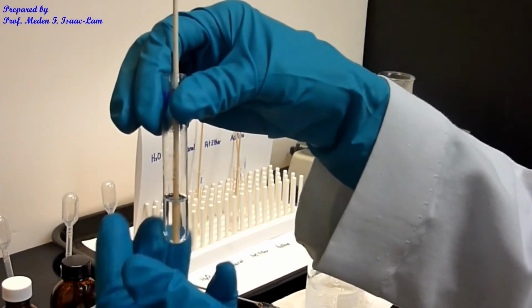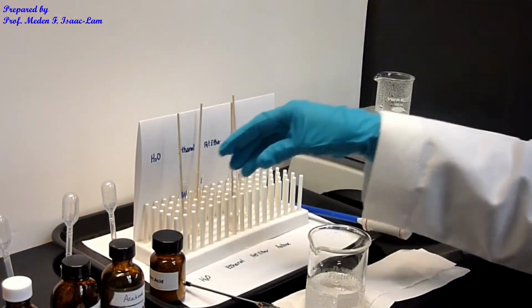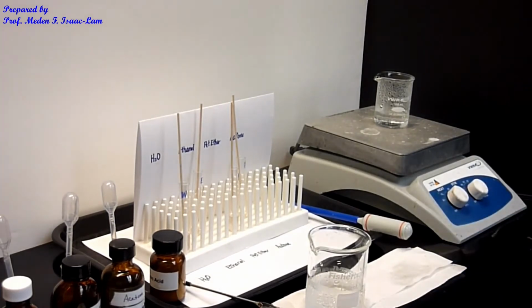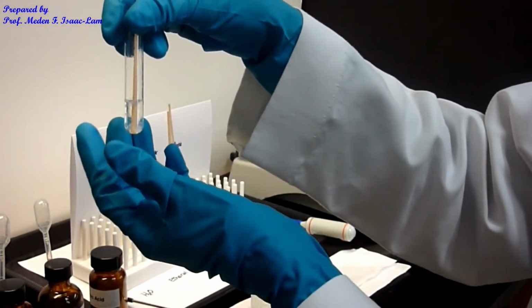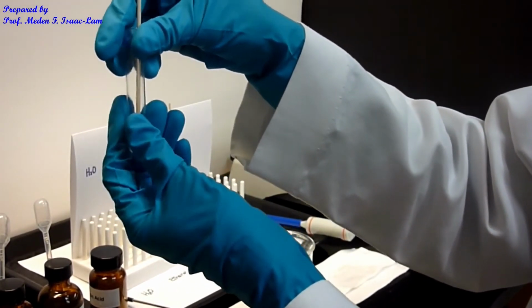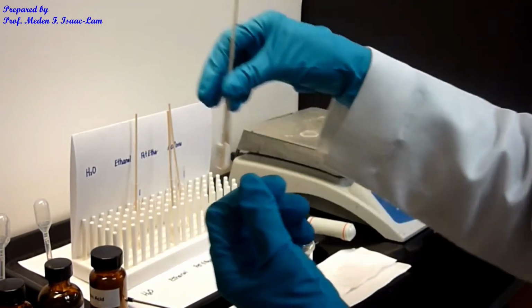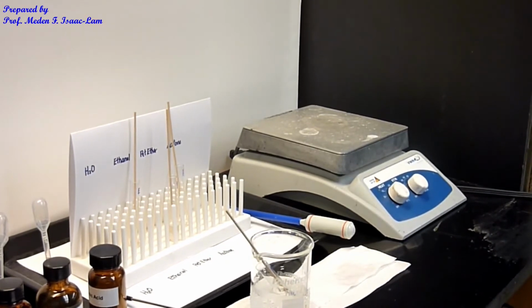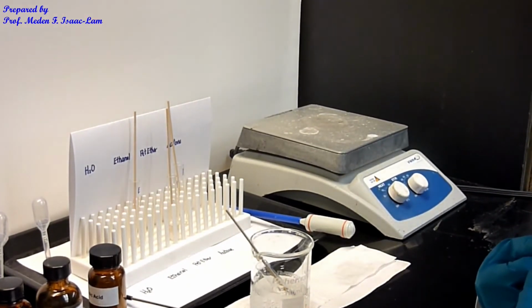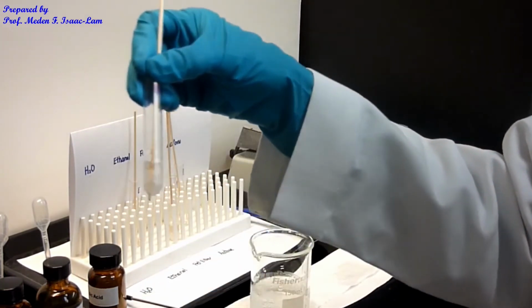Okay. So when it gets to room temperature, I'm going to stick it again into the ice water bath. I'm going to let it sit for a few minutes, and then I will stick it in the ice water bath. It's still a little bit warm, but I think it's not as hot anymore when I touch it. So you can see that it actually starts to crystallize out. So I'm going to stick it in the ice water bath to get back my crystals. Just a few minutes, and so I get back all the crystals here.